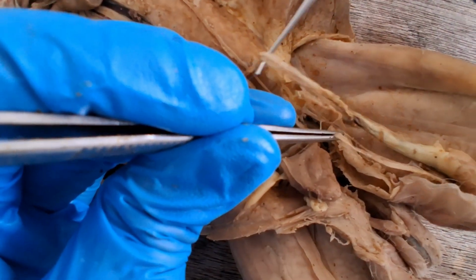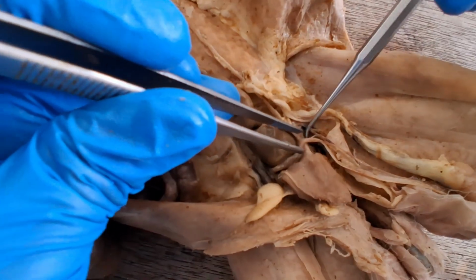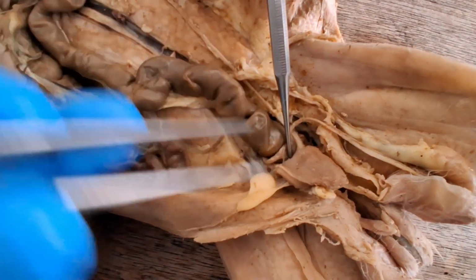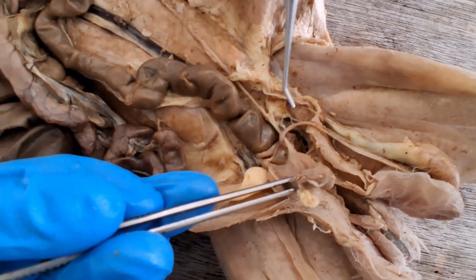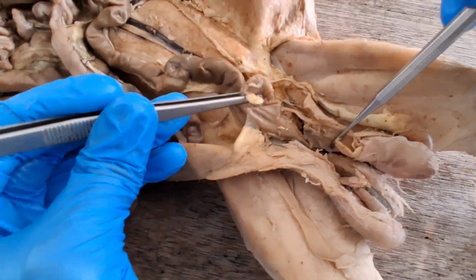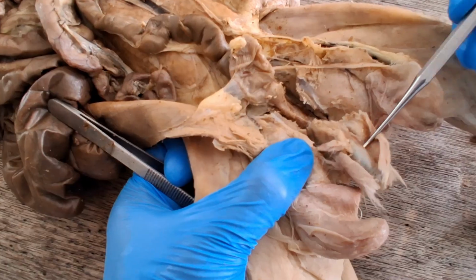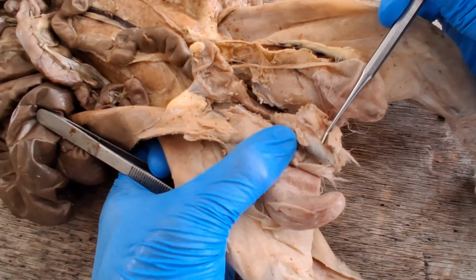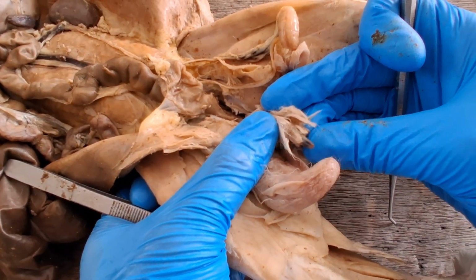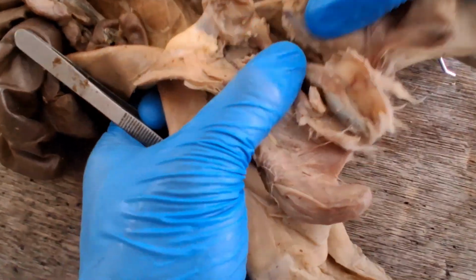While the rest of the spermatic cord goes straight up, you can see that the vas deferens makes a U-turn down there behind the urinary bladder, because the goal is for the sperm to reach here, the penis, where the urogenital opening is located. So this is the penis. That black end is the glans penis. When you skin the penis, you'll see the shaft of the penis.